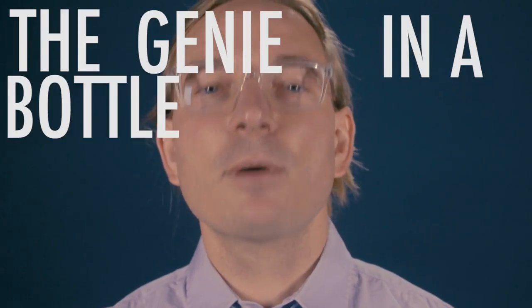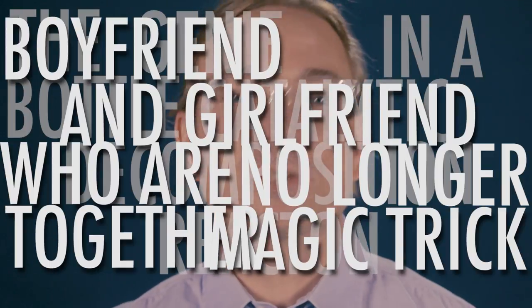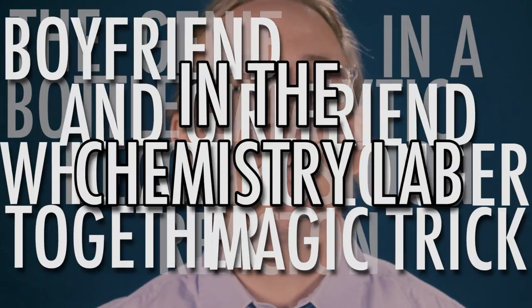So there you have it: the genie in a bottle catalytic decomposition reaction boyfriend-and-girlfriend-who-are-no-longer-together magic trick chemistry lab experiment. Wow, that is a mouthful. Maybe that's why we just stick with genie in a bottle — that's way easier to remember. Leave us a like if you liked the video, and tell me in the comments what you would do with three wishes. I know what I would do and I'm not going to tell you. That's it for me being chemistry teacher. I'm out.